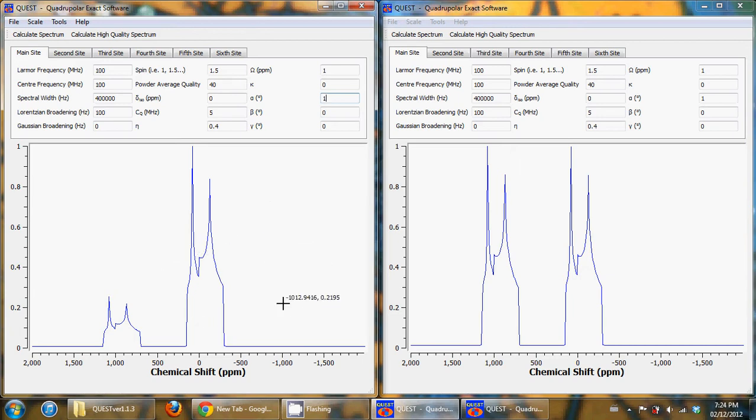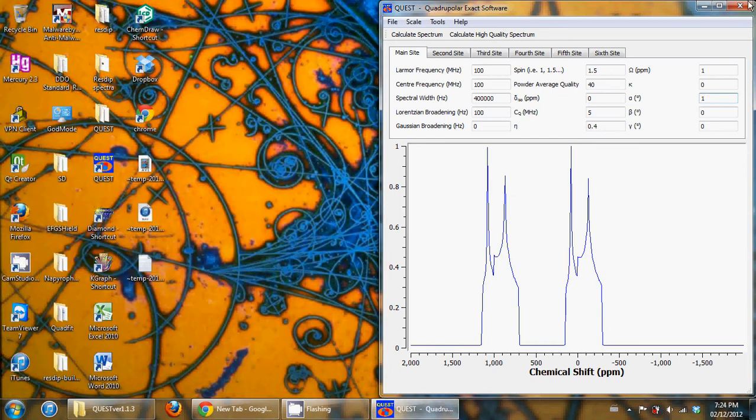being 4 times higher. In the newer version, this is corrected, where you can now see that the intensity of both sites is still correct. And so you would get the correct results if you include multiple sites, some of which have CSA and some of which don't have any CSA.